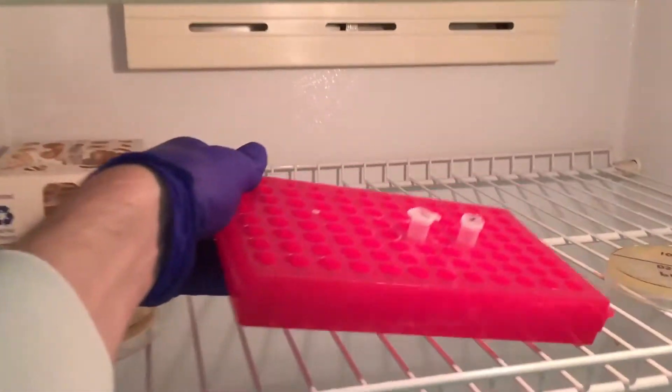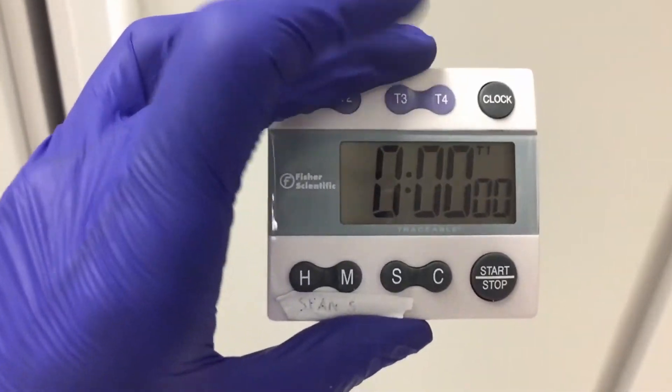Incubate the transformation reaction at 30 degrees for 30 to 90 minutes. Get some fresh plates ready for plating the transformed cells.